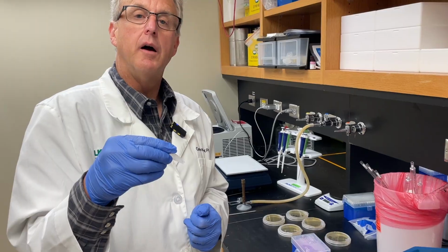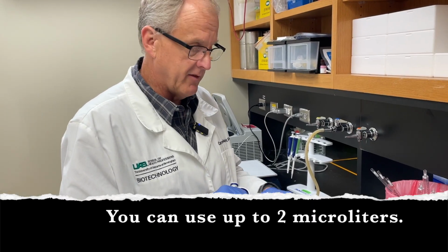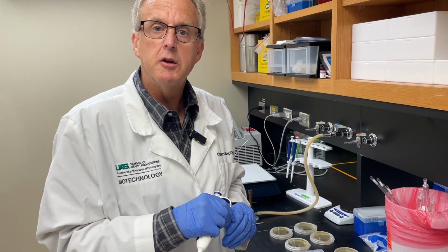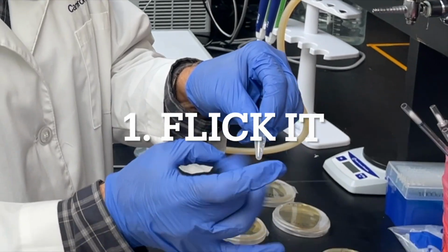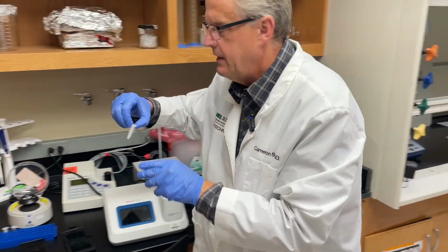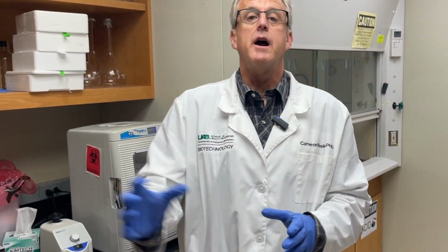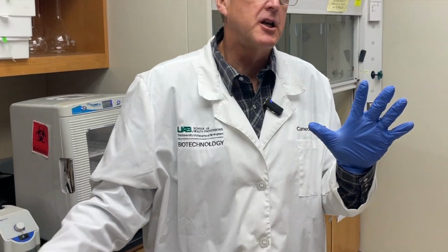Our plasmid, I'm going to add 1 microliter. You can actually add 1 to 2 microliters in there. When we do this, I'm going to flick it real fast, centrifuge it, and then we're going to incubate it on ice. There, put it in, mix it like that, quick centrifuge. Now we incubate on ice for 30 minutes. During this time, the plasmid will come into contact with the competent E. coli. However, we're setting it up for the plasmid to go in. We'll come back in 30 minutes to see what to do next.